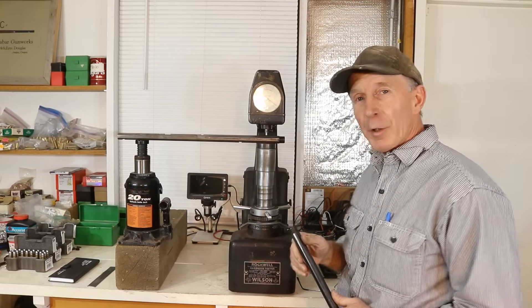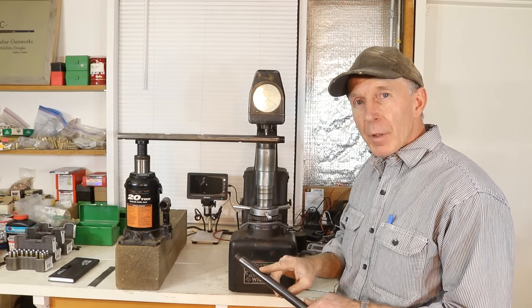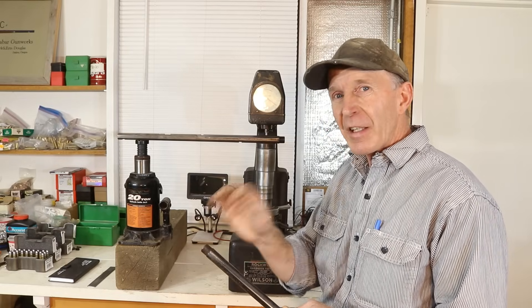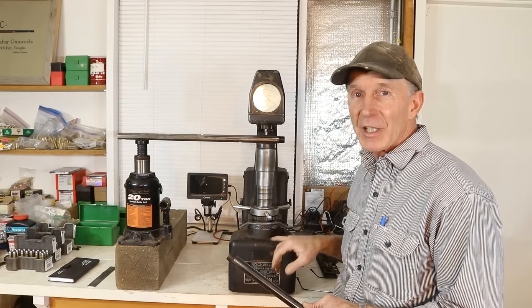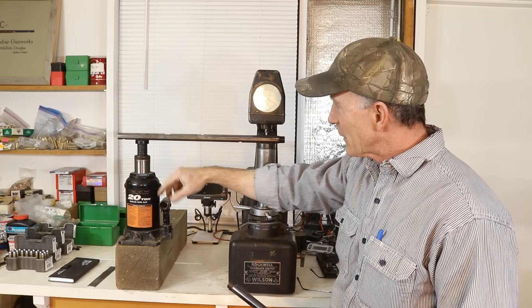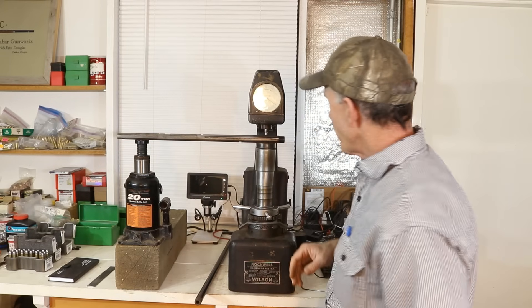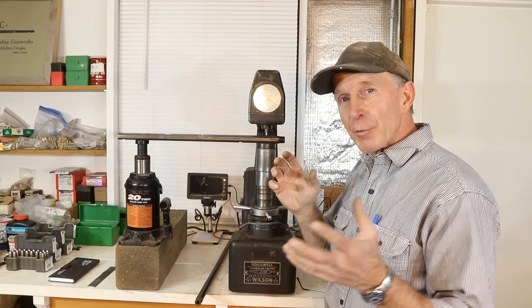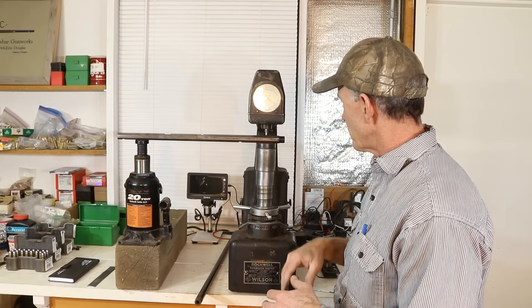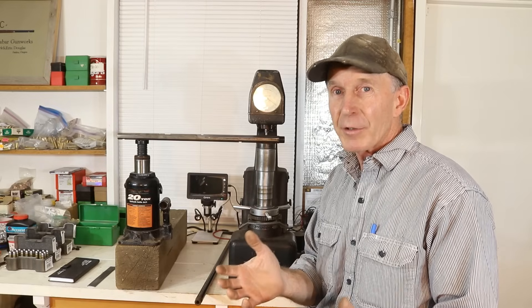Here's how we're set up for testing these Winchester barrels — it's a little Rube Goldberg, but we want to test down towards the breech end, underneath the bottom side of the barrel. If you look at many Winchester barrels, there's a lot of stampings down there, and one you see regularly is a little punch dot — I think that was probably a quality control measure using a machine similar to this testing the hardness. We've got a jack to support things. This first one should be just soft steel — an old 1886 barrel in .40-65, hacksawed off with extra dovetails, not much of a bore — a good test piece. We'd expect a hardness similar to our mild steel test piece.